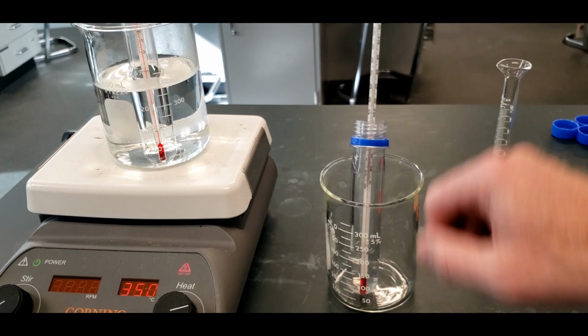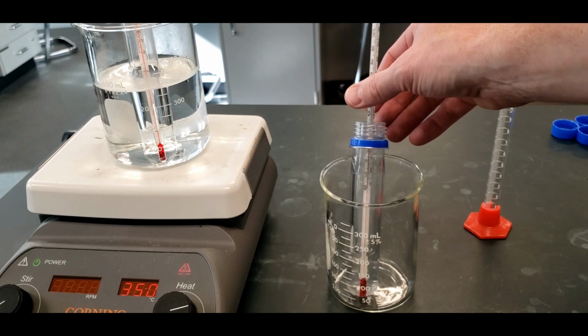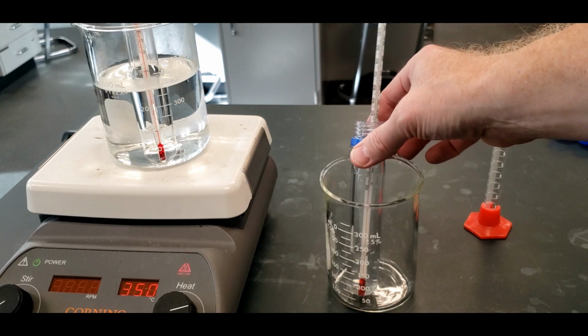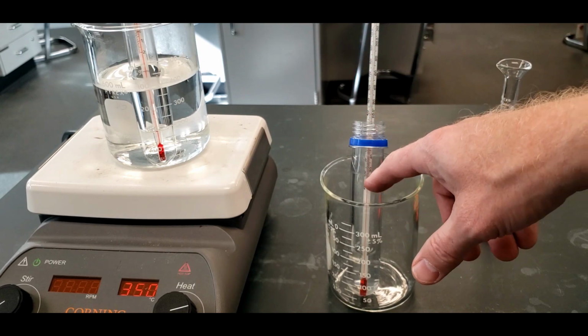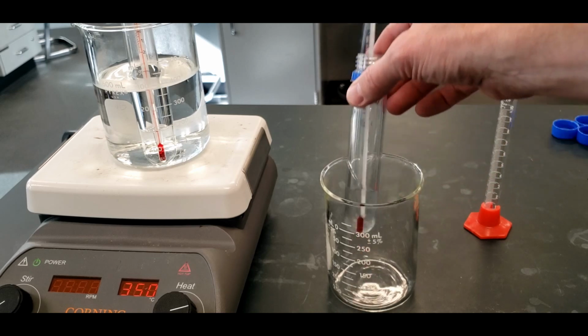And that's going to mix with the room temperature water. And then we will see what the result is. Because what we're trying to do, if you took 1170, then you will know that we did this experiment before to find the heat capacity of the calorimeter. We used a coffee cup calorimeter for that. Here we're going to be using this plastic one.